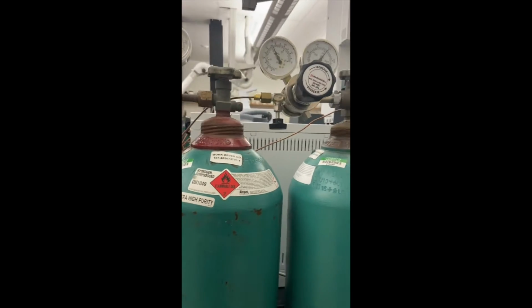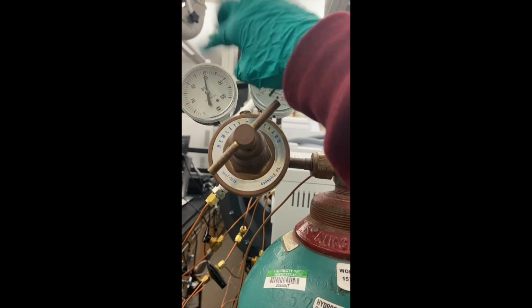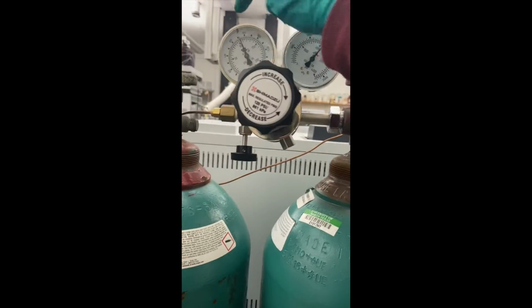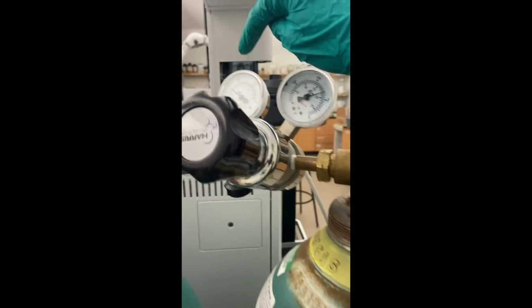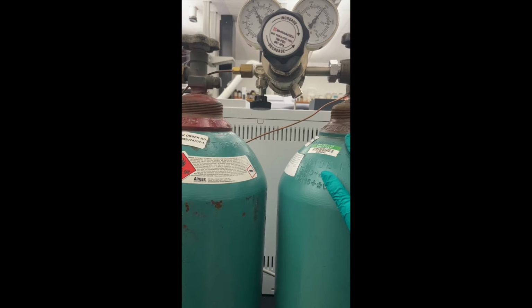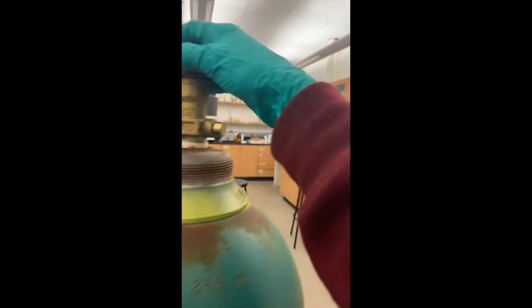So all you guys have to do is come over here and check that the pressure is correct on this guy. You always want to get used to that whenever you're working with instruments. You never want to have the incorrect pressure, because it could damage your instrument and it would shut down on you. So we don't want to do that. These are already on. All you have to do is check the pressures.